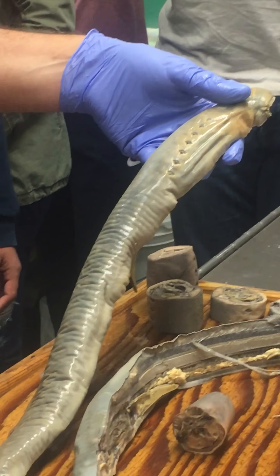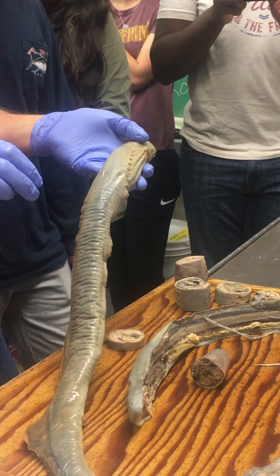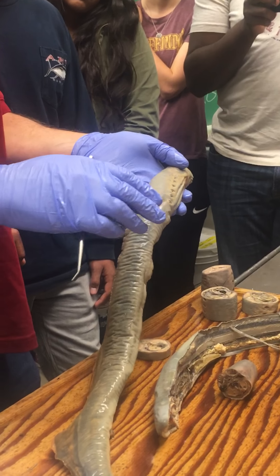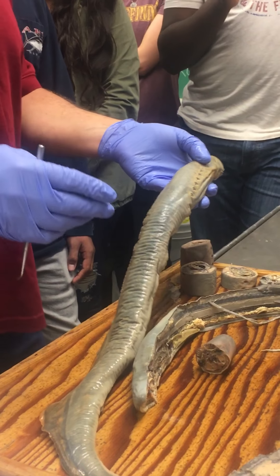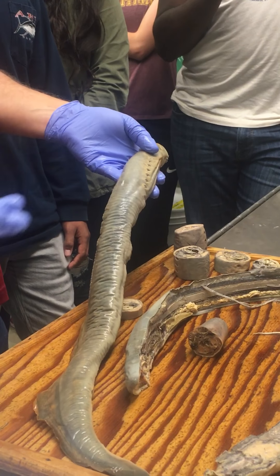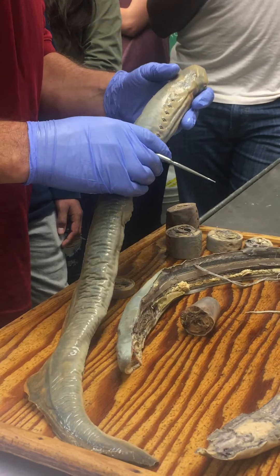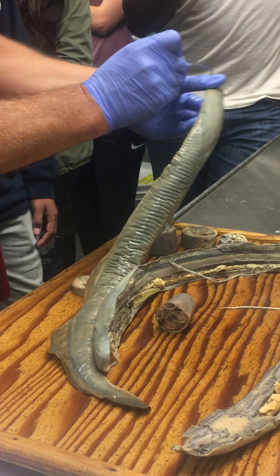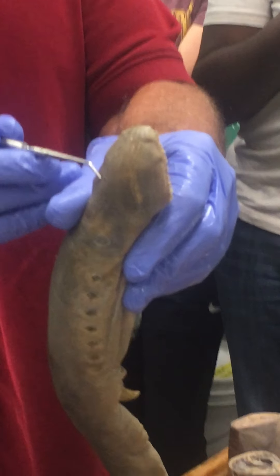The lateral line system detects motion and movement, particularly of the water — detecting water movements around them. It gives sensory feedback on their own movements through the water, but also if there's some disturbance from a predator or prey. In terms of seeing it, you can see these pores like this on the head, and those are openings into the lateral line system.